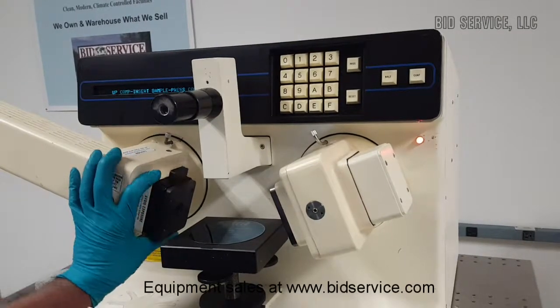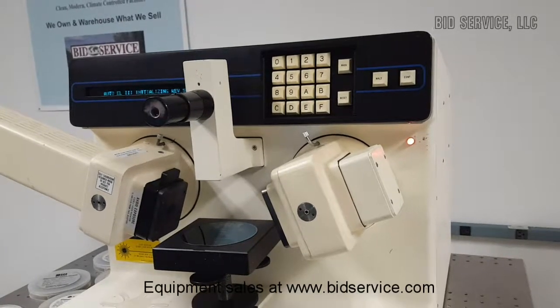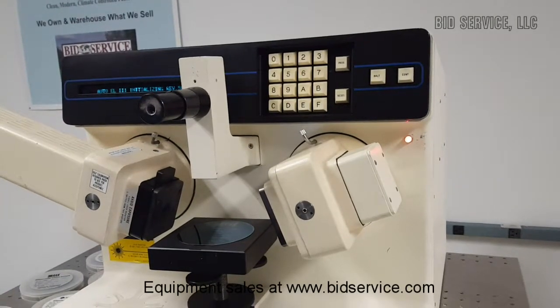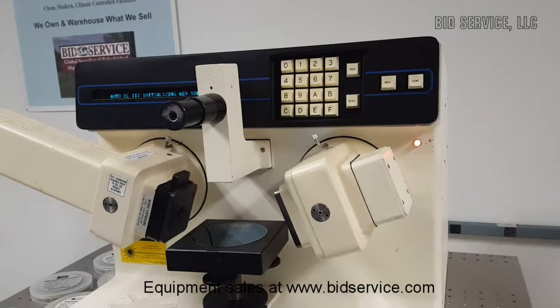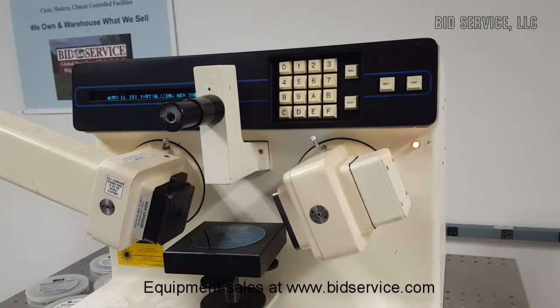I'm going to bring up the compensator. At any point if you want to halt the meter, use the halt key. At any point you want to cancel or clear data entered, use C. The decimal point is entered using the letter D, and E is enter.